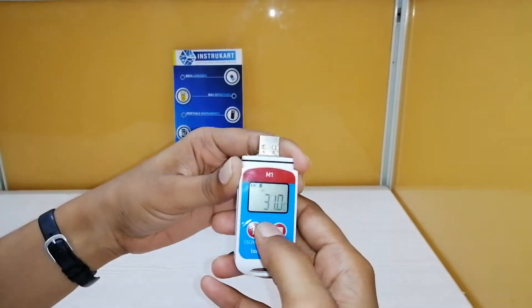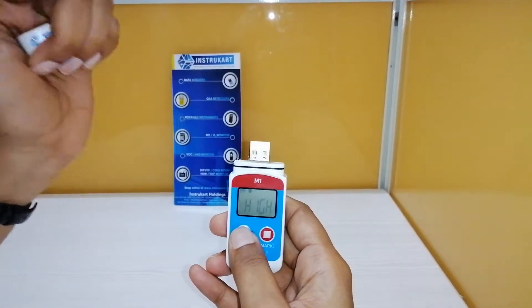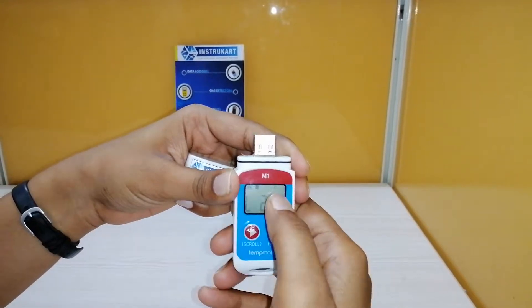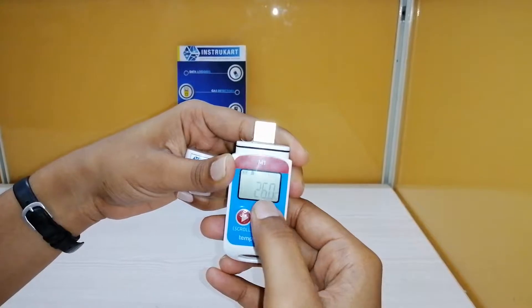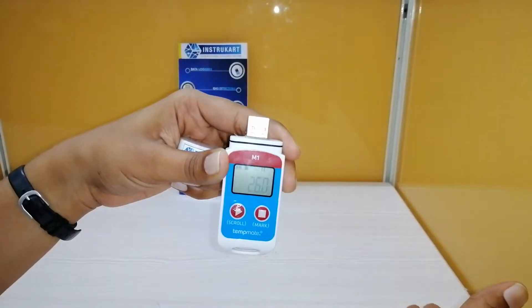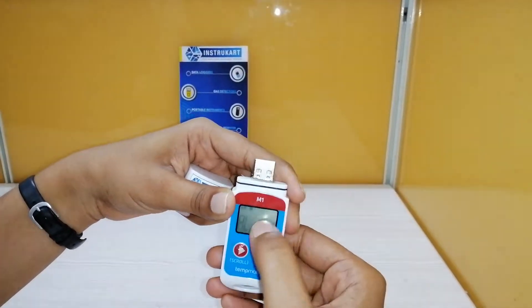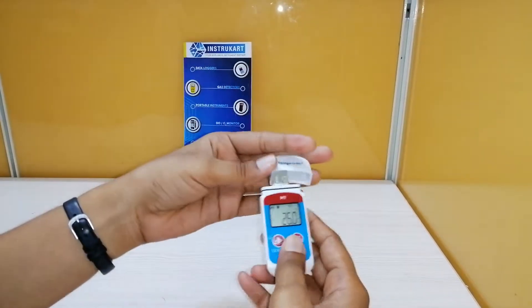This is the maximum temperature recorded in degrees Celsius, the minimum temperature, and the higher alarm limit we have set which is 28.0, and the low limit is 26.5. The current temperature is 26.0, which means at some point it was over the higher limit and at some point less than the lower set point, so it is showing both indications as per the recordings recorded till now.